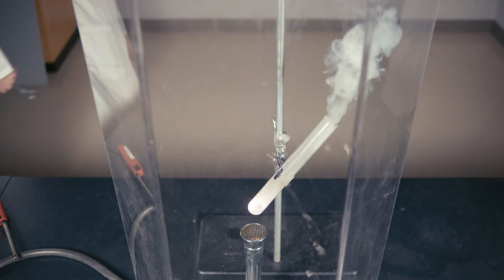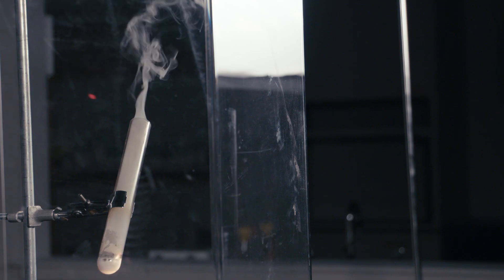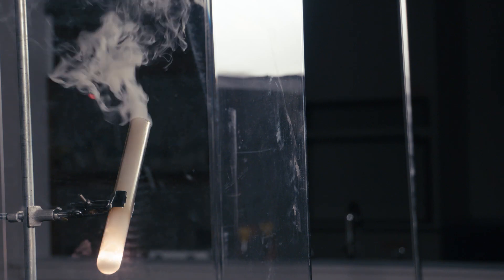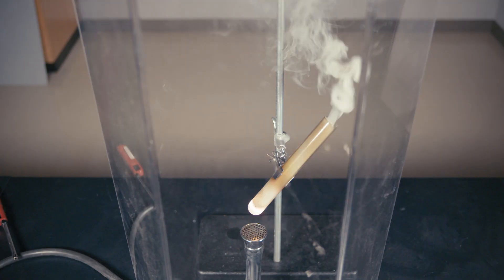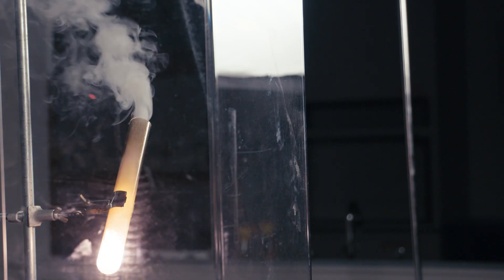The second one of these little guys hits the liquid, two things happen. It starts to physically melt because the candy shell is designed to do so in any liquid. But this isn't just any liquid. It's potassium chlorate, an oxidizing, reactive, somewhat unstable compound. Like we said before, potassium chlorate is known to be a strong oxidizer, which means it gives up oxygen. A lot of it. In this case, when we melt it. So that's exactly what we're going to do.